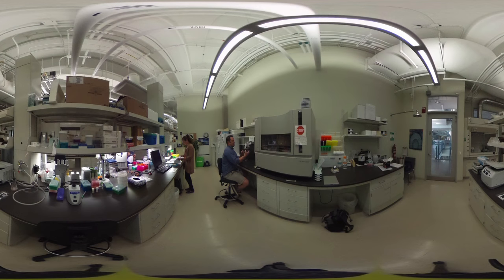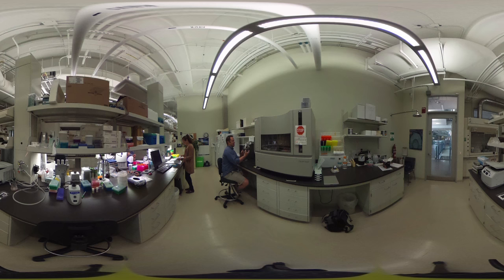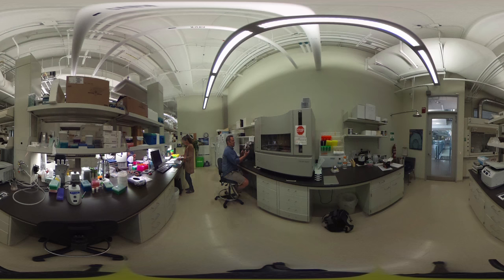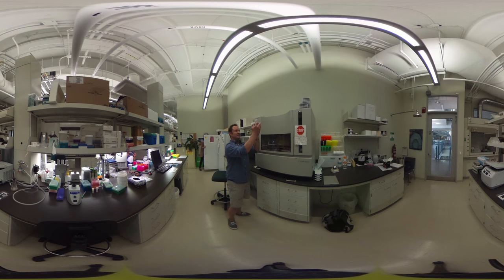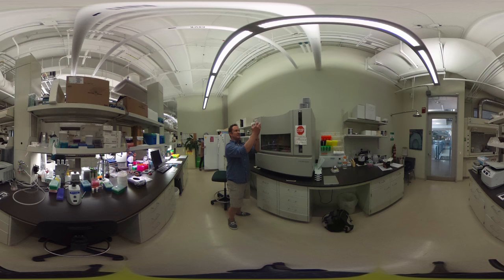We're looking at a Sanger sequencer. In general microbiology, this is used for cloning, genome walking, looking at very specific pieces of DNA, and making sure the sequence you're looking at is the sequence you think it is. The throughput is much smaller compared to next-generation sequencing, but the data quality that comes out is extremely high.